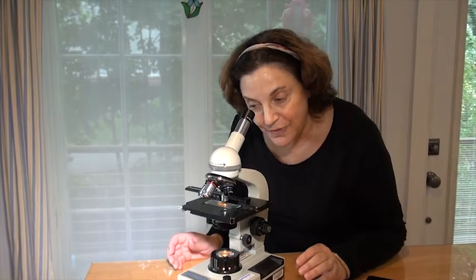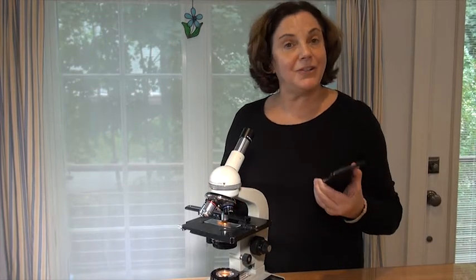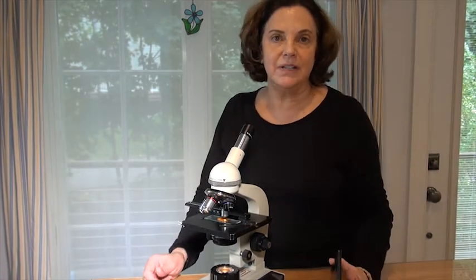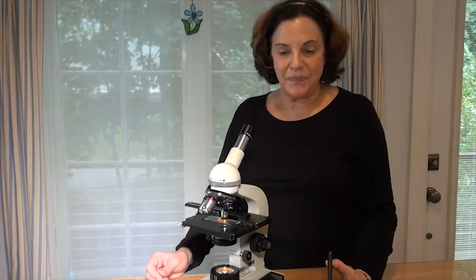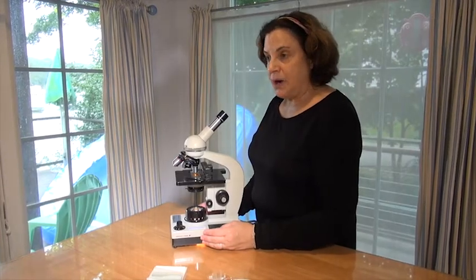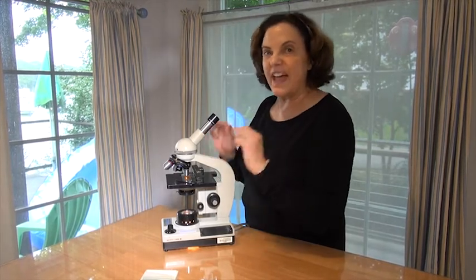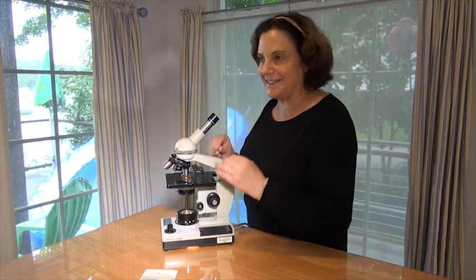I have my phone here. It's okay to use your phone to take pictures through the microscope — those are pictures you can actually submit. This last section is about cleanup and how to stow the microscope correctly. A correction: I mistakenly said onion earlier — this is clearly a potato. So iodine stains the starch in the potato a dark purple.